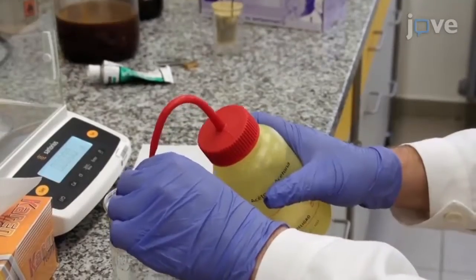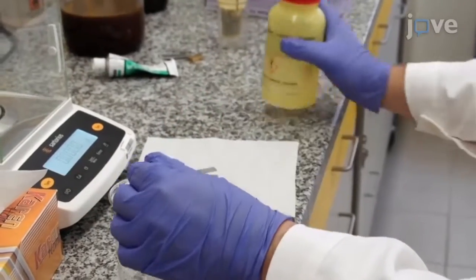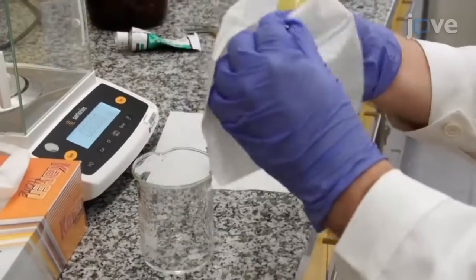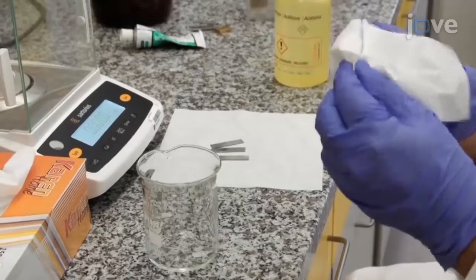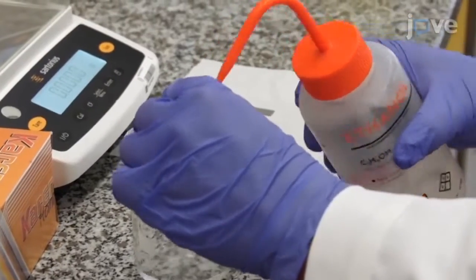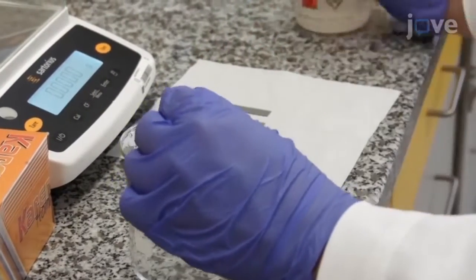Next, thoroughly degrease the sample surface with about 25 milliliters of acetone liquid and about 25 milliliters of ethanol.